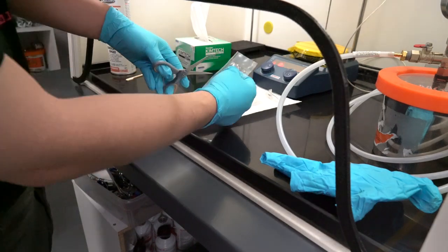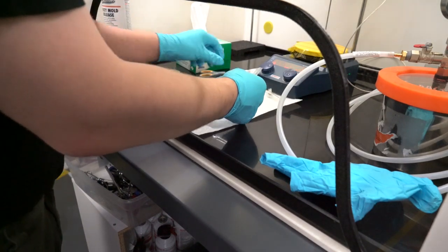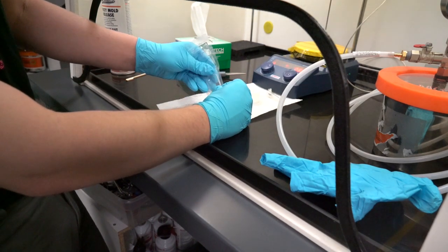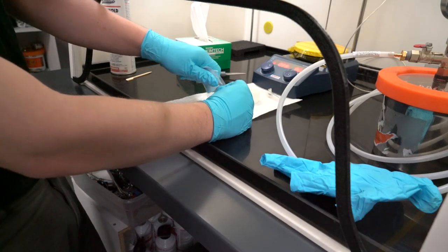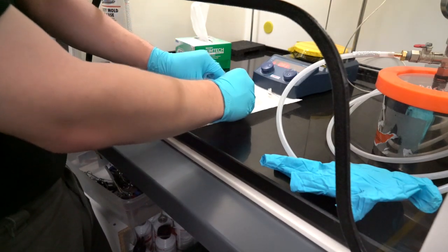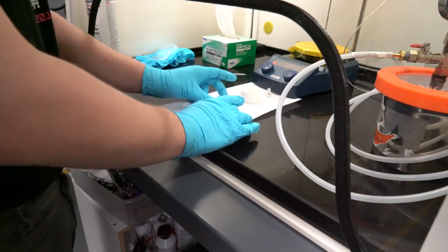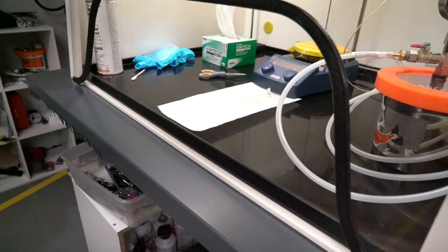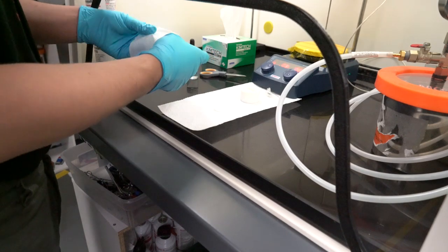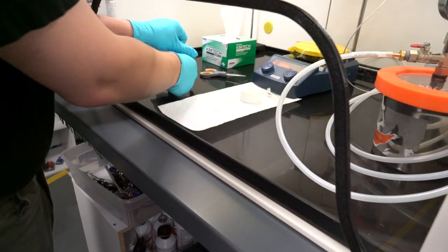To do that, you're going to cut a corner off the packet and pour our mixed epoxy out into this little plastic ketchup cup. They're a lot cheaper than official labeled beakers and they do the job just fine. We don't need graduations or anything — it's all pre-mixed anyway. I'm just going to make sure we go clean off any epoxy that's stuck to the scissors so we don't get them stuck shut for all eternity.